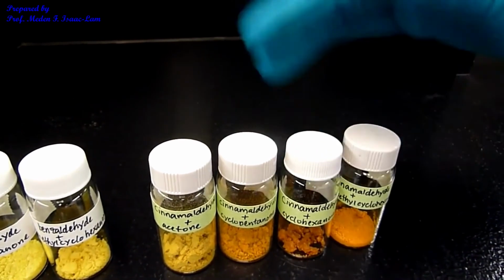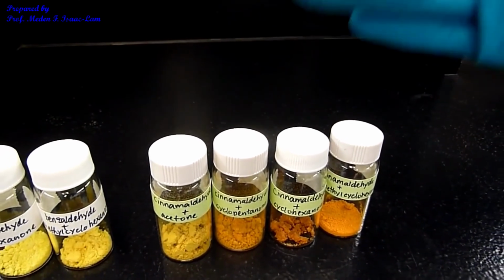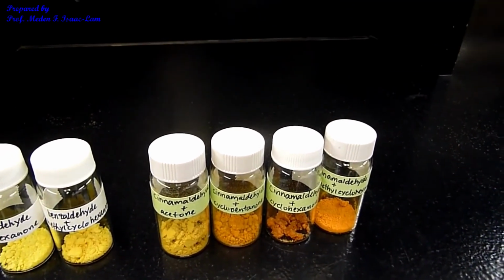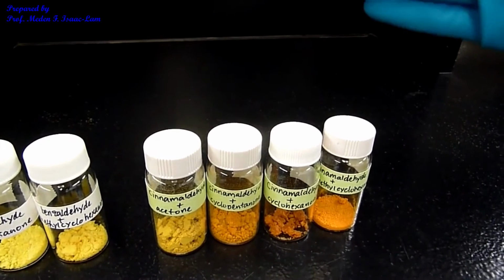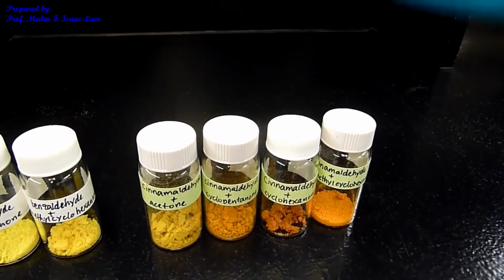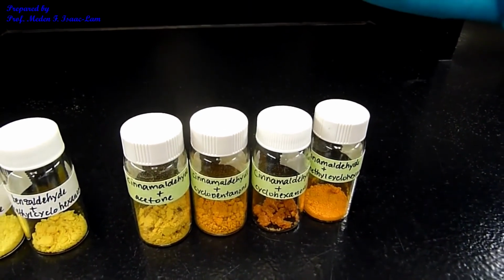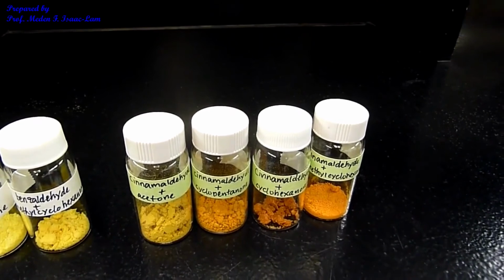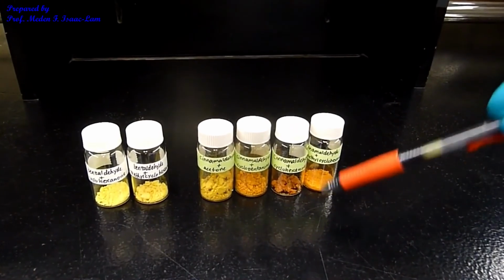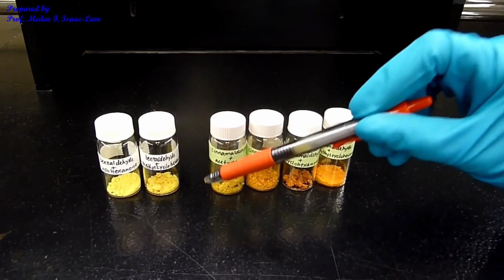So again, they're all conjugated structures, and that's why it's colored, and also we created a bigger structure or bigger molecule. That's why the sample is now a solid, and we started with both liquids. The aldehyde is a liquid, and then the ketone is also a liquid. So for the experiment, you are going to identify the identity of the aldehyde, as well as the ketone.